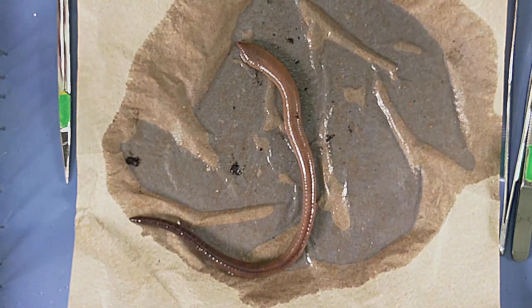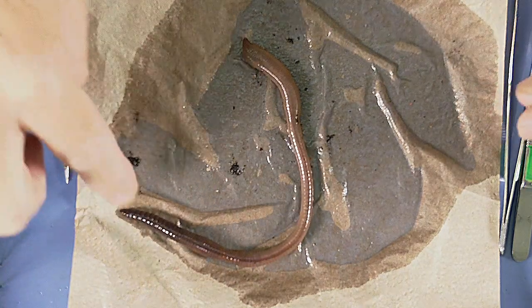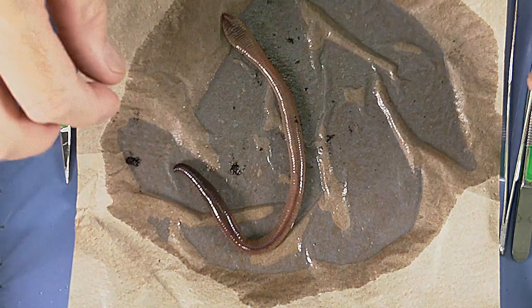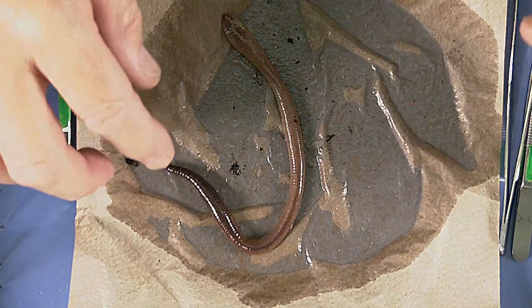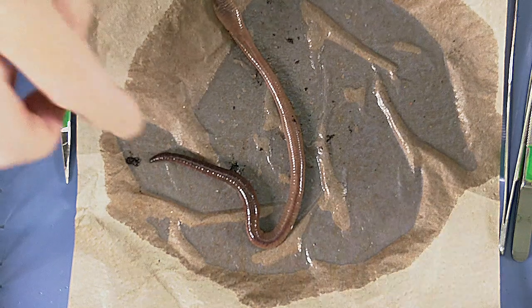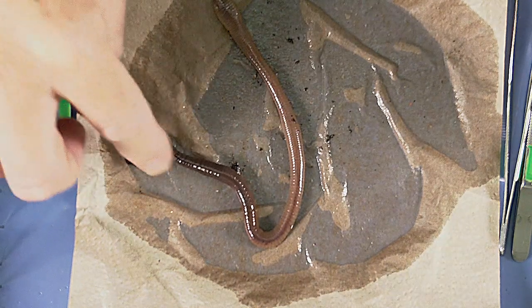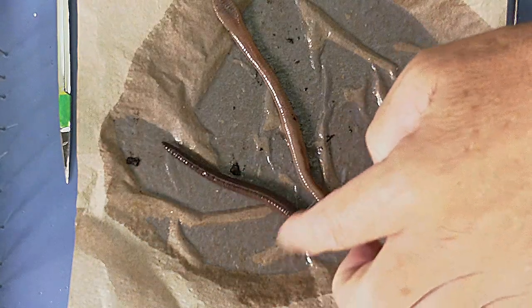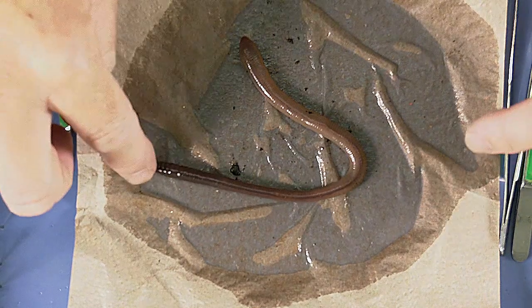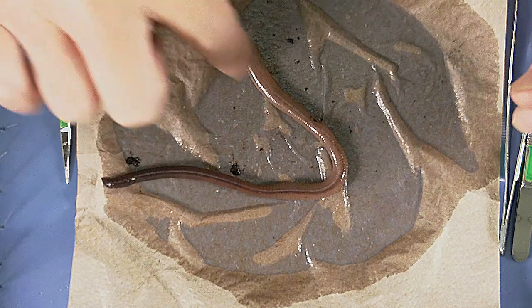Most annelids have little bristles along their body called setae. On some annelids they're really obvious; on this one they're not so obvious, but we can feel them. The phylum Annelida is divided into two classes: the polychaetes, or class Polychaeta, and the oligochaetes, or class Oligochaeta. The earthworm — Lumbricus terrestris — is in class Oligochaeta, meaning it has just a few bristles per body segment.